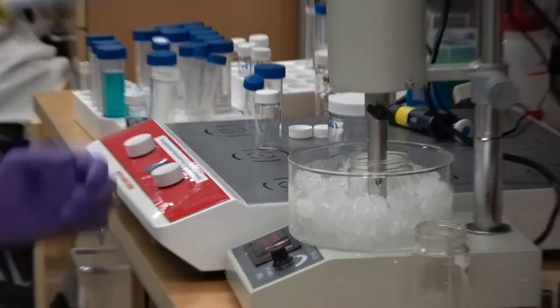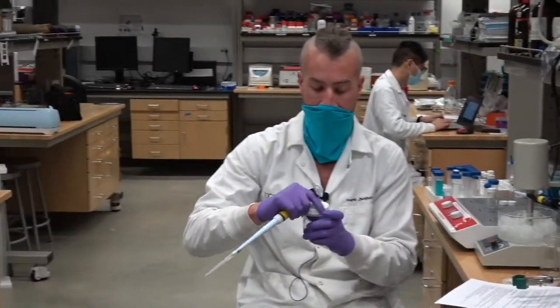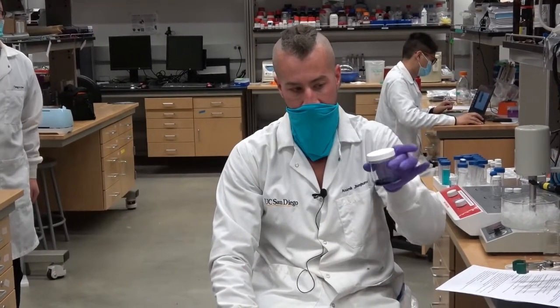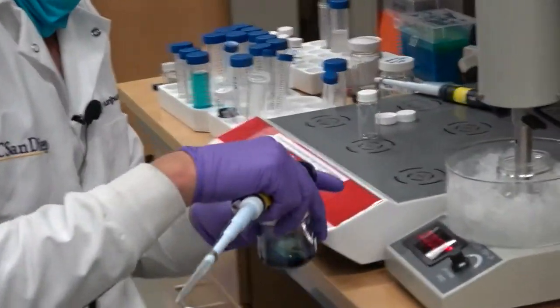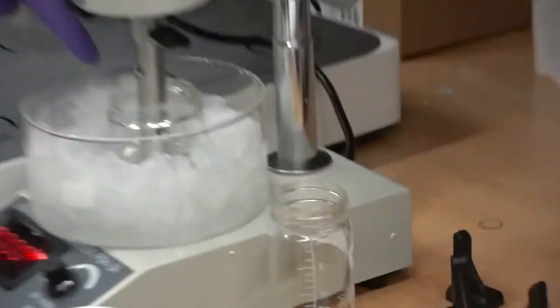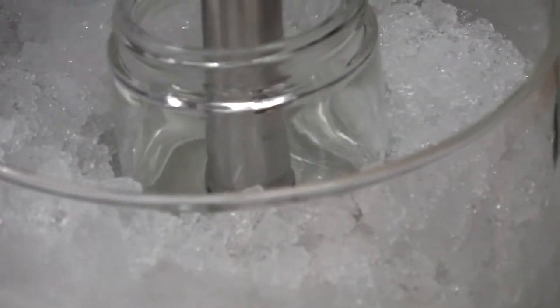Now the other thing that you missed is Teng-Yu adding PLGA and methylene blue and dissolving it in dichloromethane. So this is now my dichloromethane solution. So get in here and see how we're going to do this. Zoom down in there and make sure they can really appreciate that this is not touching the bottom, but it's very near the bottom.